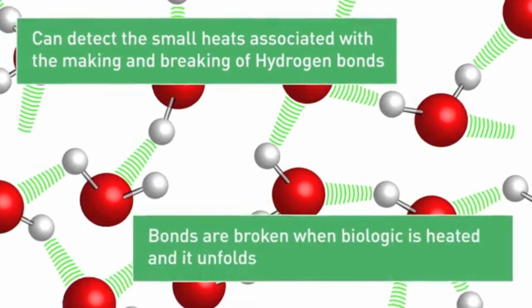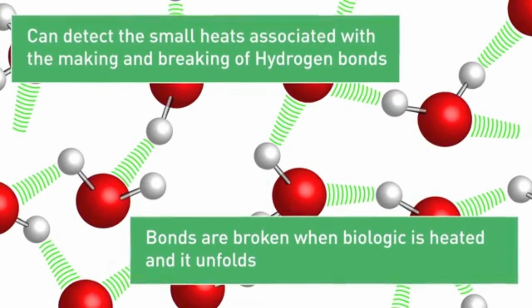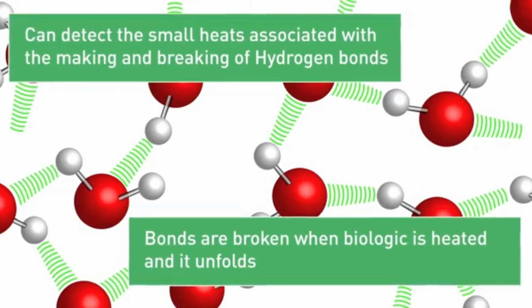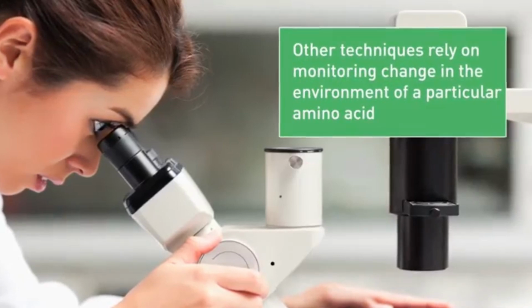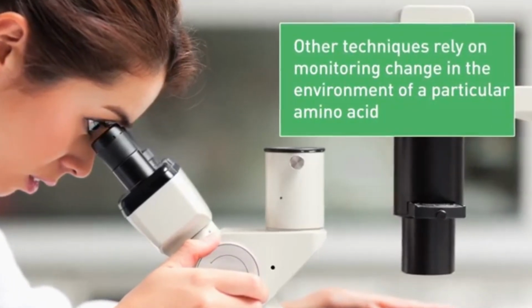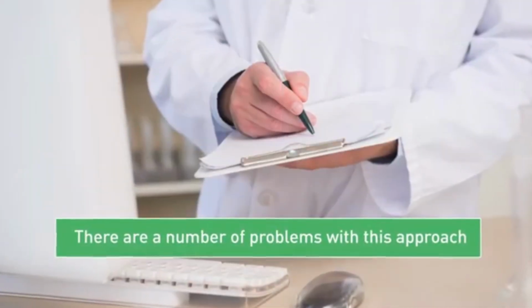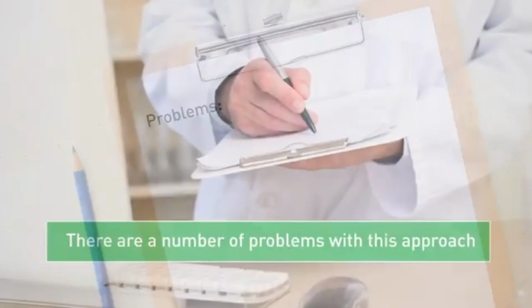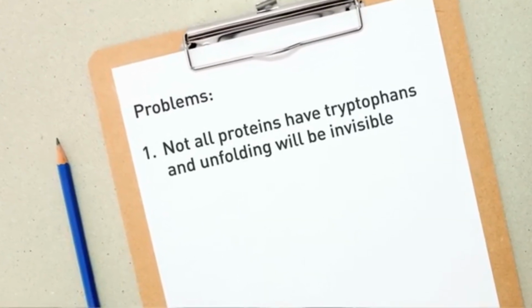These bonds are broken when the biologic is heated and it unfolds, a process which absorbs heat and is detected by the calorimeter. Most other techniques used to measure protein stability rely on monitoring the change in the environment of a particular amino acid, often a tryptophan. There are a number of problems with this approach. Firstly, not all proteins have tryptophan, and the unfolding will not be observed.